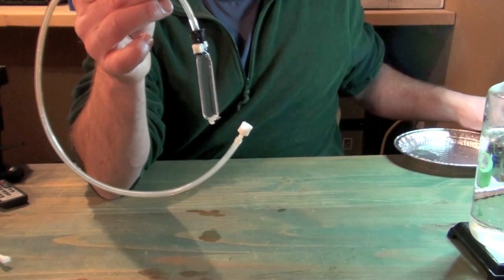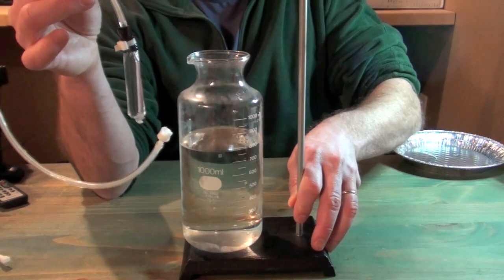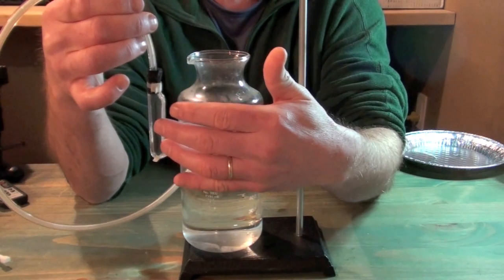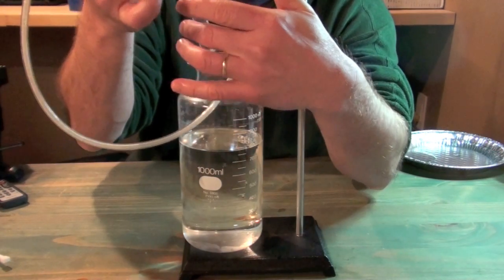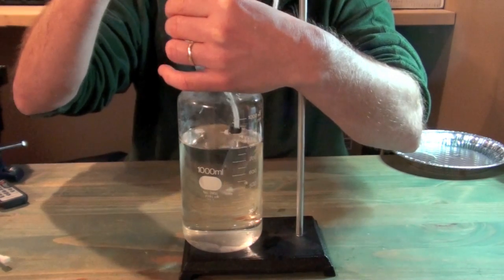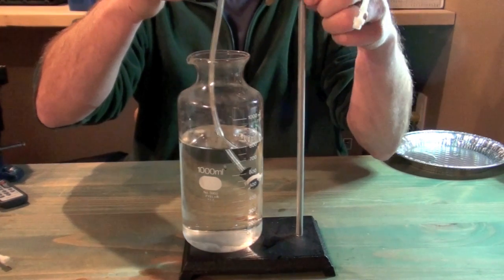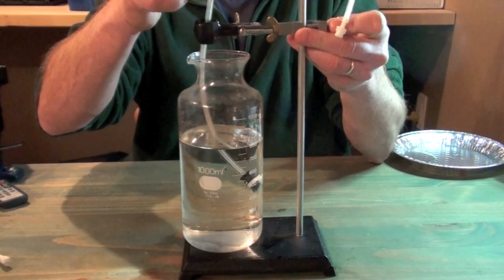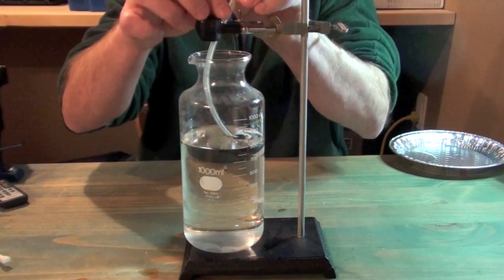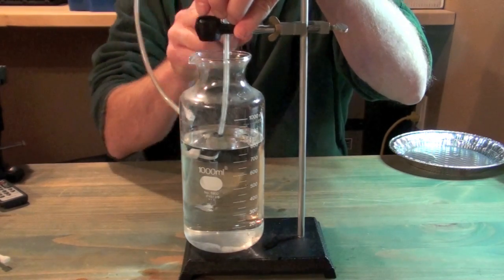So we're going to insert this into our surrounding solution now, and what I've got here is a beaker filled with distilled water. So this is going to be our hypotonic solution compared to our hypertonic solution inside the baggie. So I'm just going to gently lower that into the distilled water. And then what I can do is take my tubing and just secure it at the top. I happen to have a clamp here, so I'll just adjust that slightly so that my tubing is hanging freely. And we can get our tubing set nice and clamped at the top.